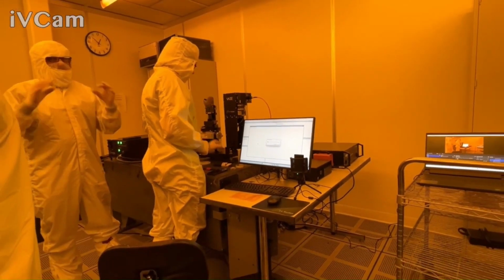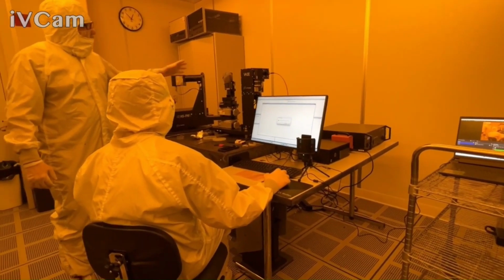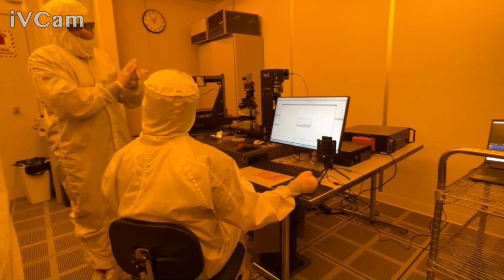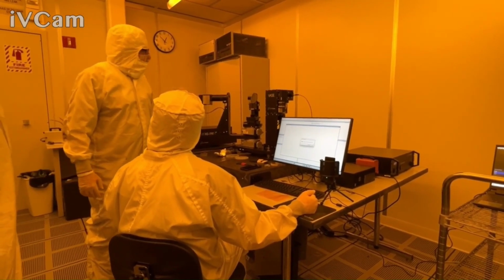For your measurements, it really depends if you want a smaller area or not. For your reflection intensity measurements, we'll probably leave it in to keep a smaller beam, so we can have a better chance of collecting that beam. Versus angle, but we'll give it a go.